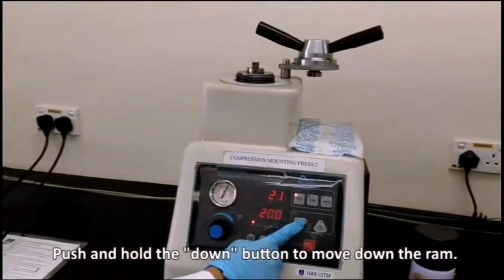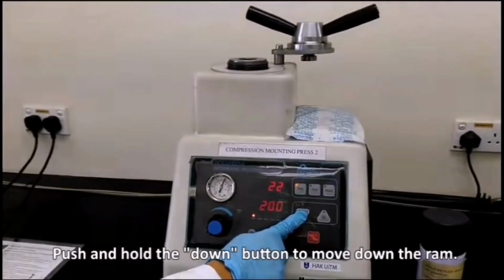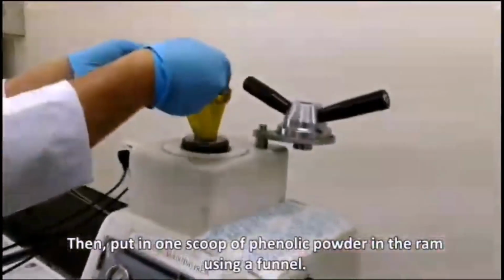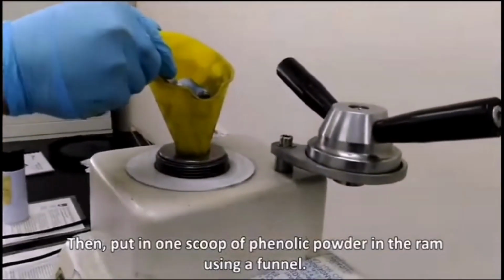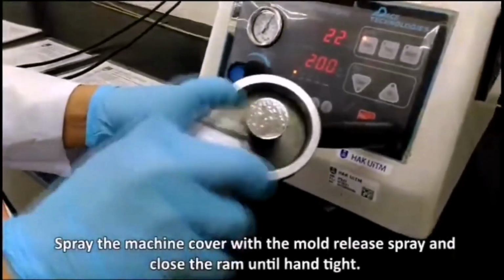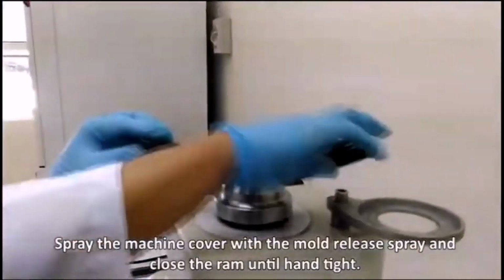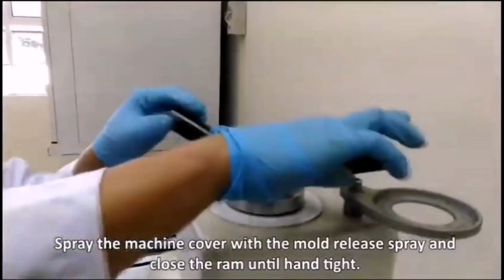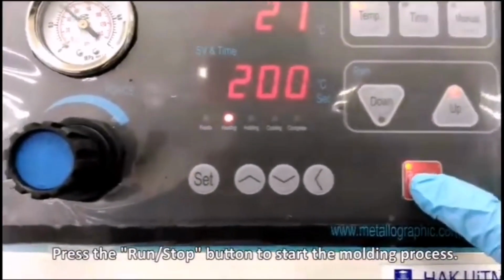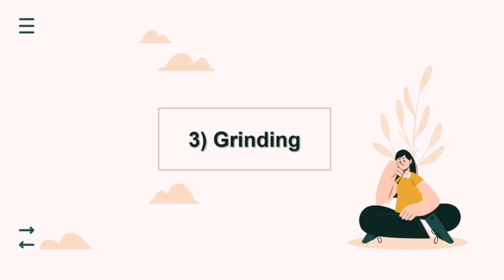As you can see, the mold is heated with the steel and phenolic powder, and then it will become a solid mount, as you can see in the video. Next is grinding.